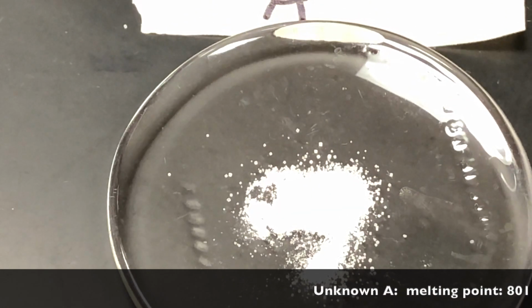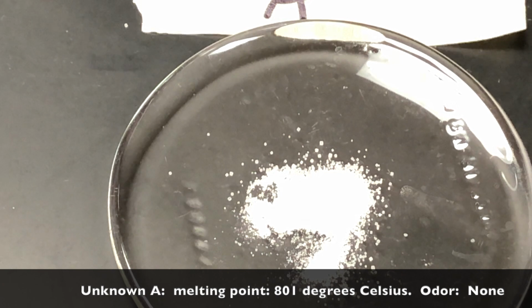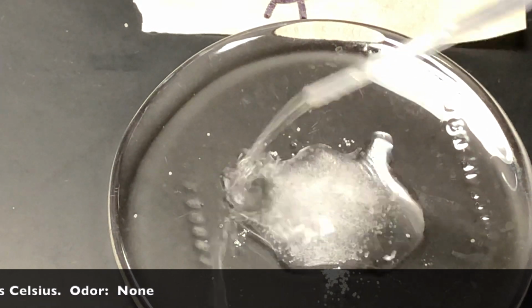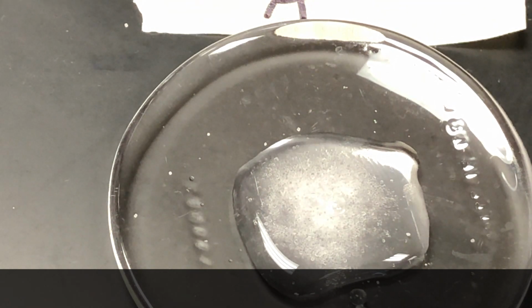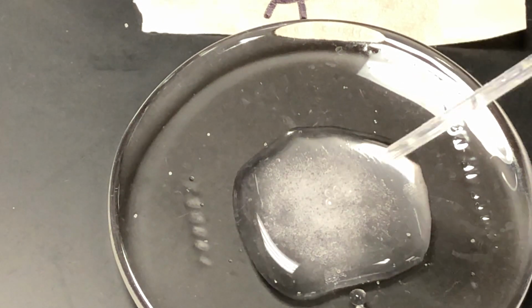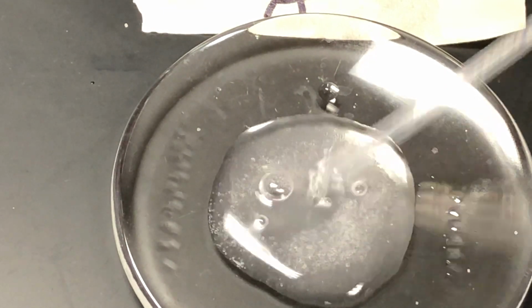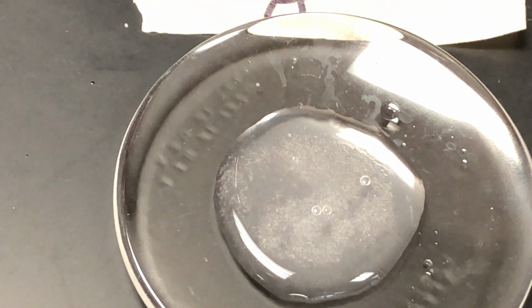Now, does it dissolve? So what we do is we get some water, and then add some water to it and see what happens. Okay. Add a little more just to make sure. It says to add about 5 or 6 drops, but let's just make sure. And then you mix it up a little bit. As you can see, some of it is going away. So that tells you that it does dissolve. Ionic substances tend to dissolve in water.